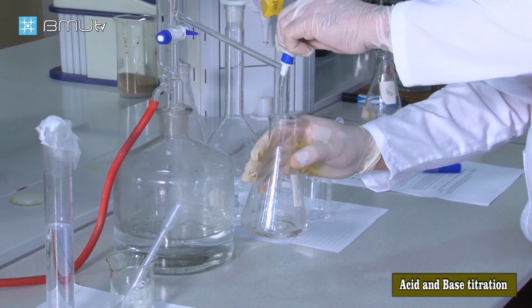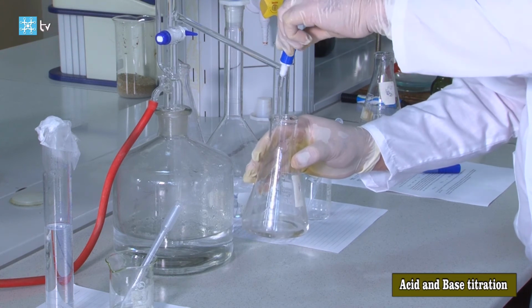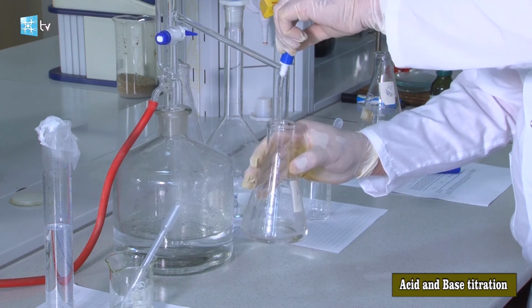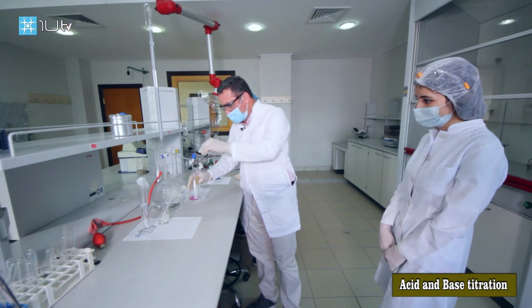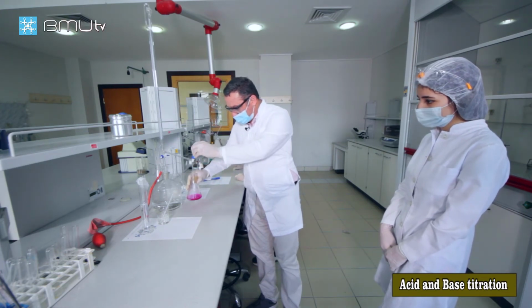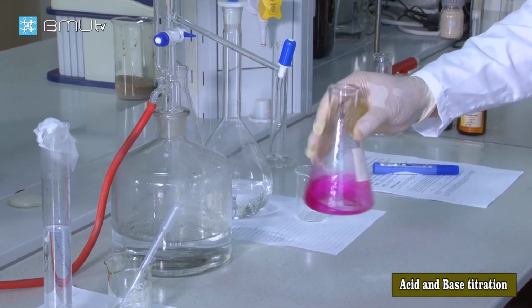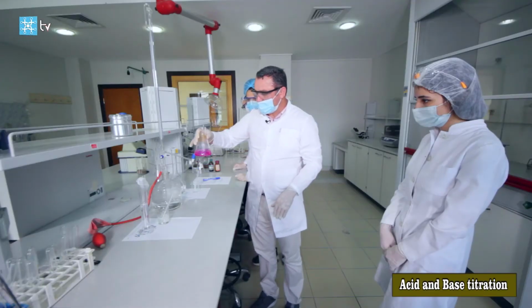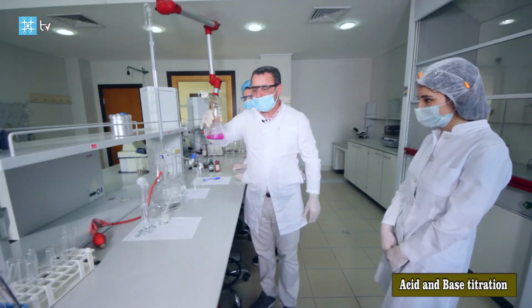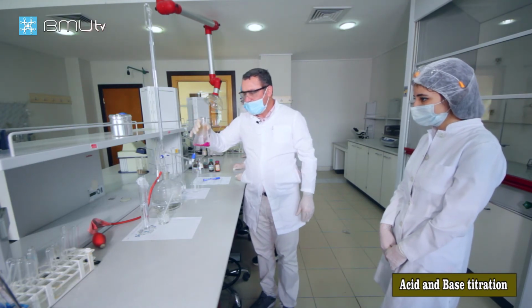And we know exactly the molarity of the titrant. Our reaction reaches the end point, and a few drops of sodium hydroxide are enough.